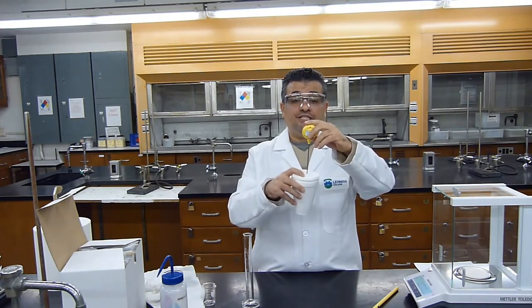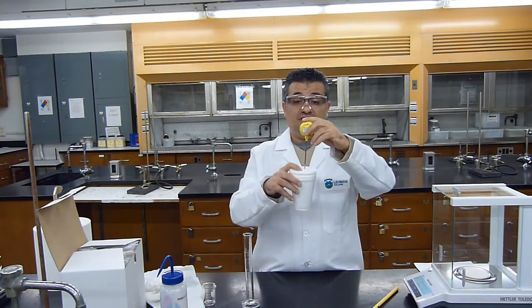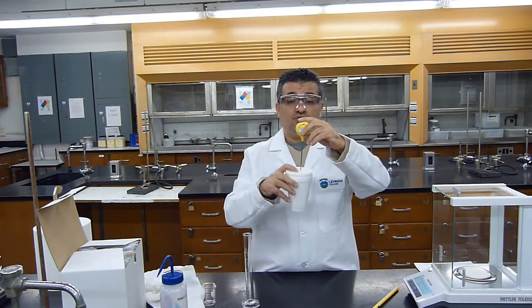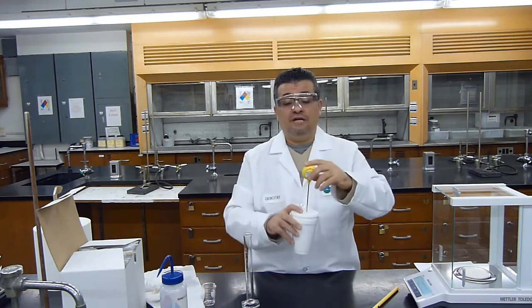I reach 37.4. Continue mixing. I just went down to 37.3, so it seems that the temperature is starting to descend. Now it's down to 37.2. I can stop, and the highest temperature I reached is 37.4 degrees Celsius.